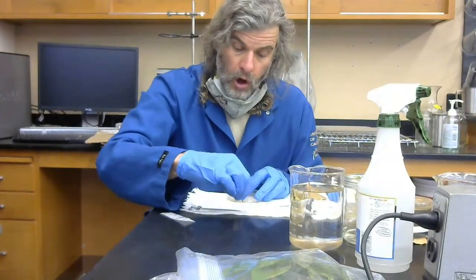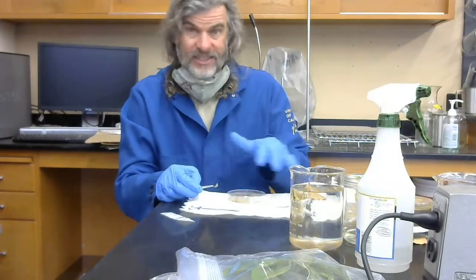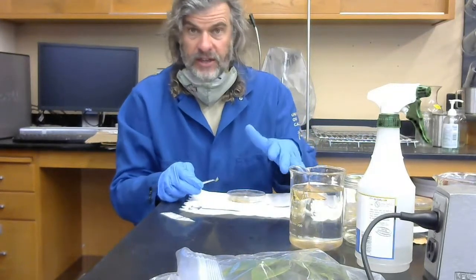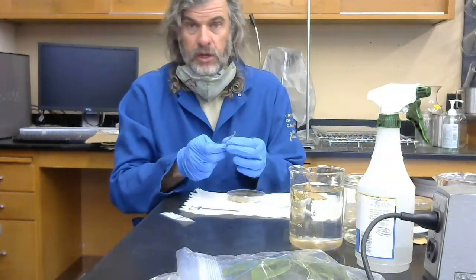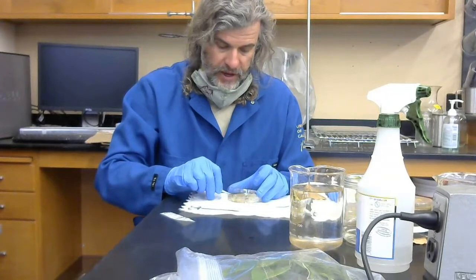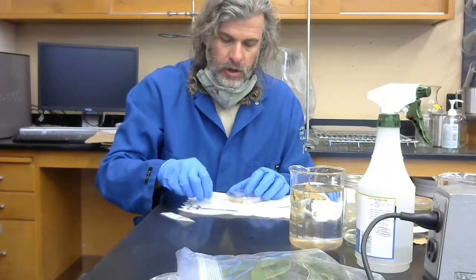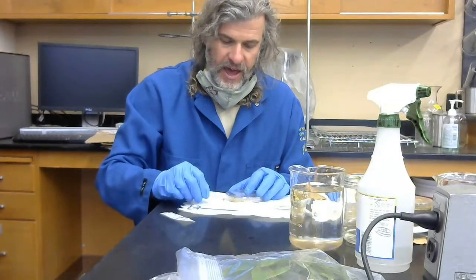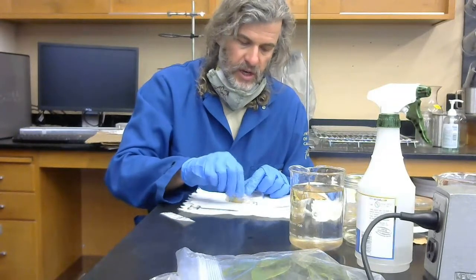I can work through all of my samples here for this particular set of leaves. Imagine I sampled from 5 leaves. I don't have to surface sterilize my tool between every single one of these, especially if I'm moving pretty fast. When in doubt, if you have any concerns, if you drop your tools or something like that, then definitely surface sterilize in between.